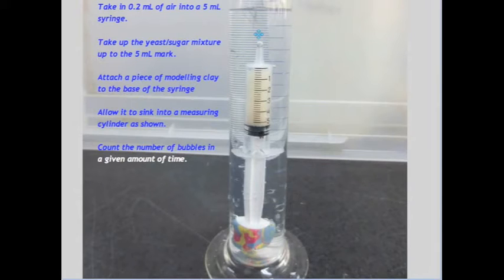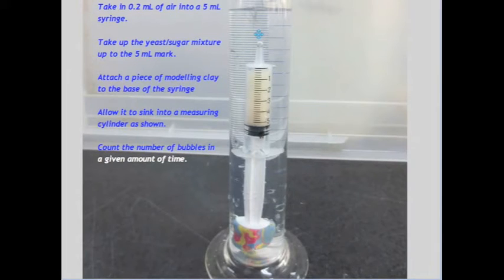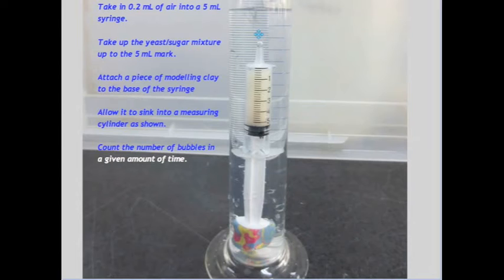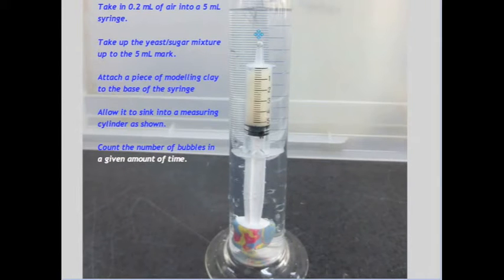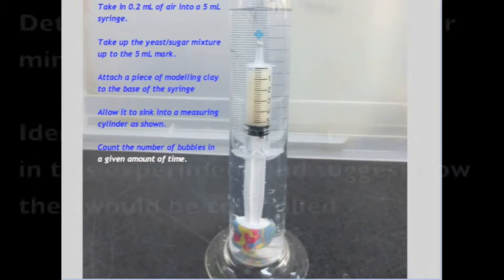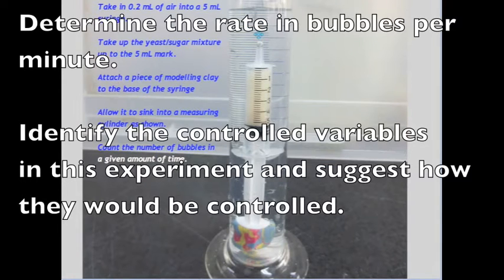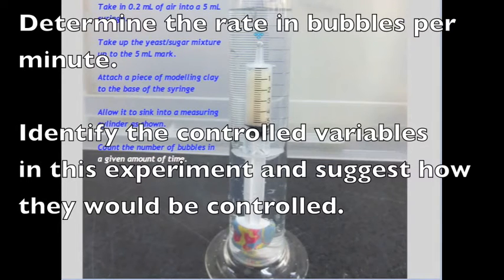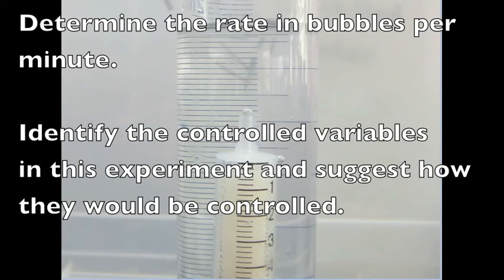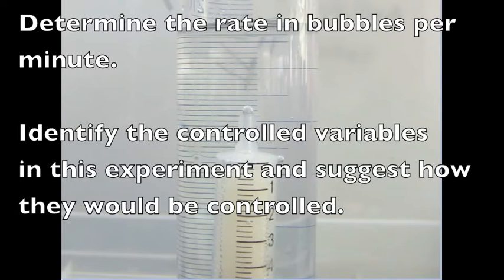The number of bubbles in a given amount of time was to be used as an indicator of the rate of the yeast glucose fermentation.